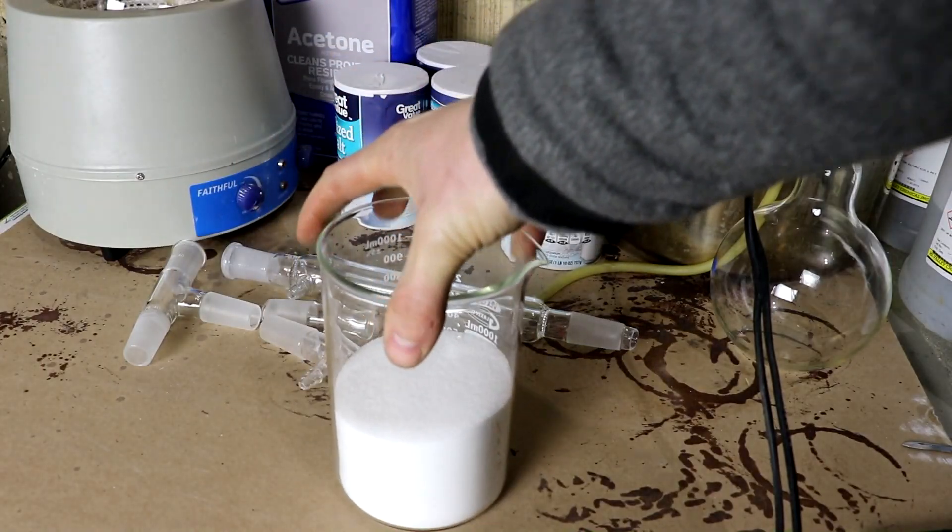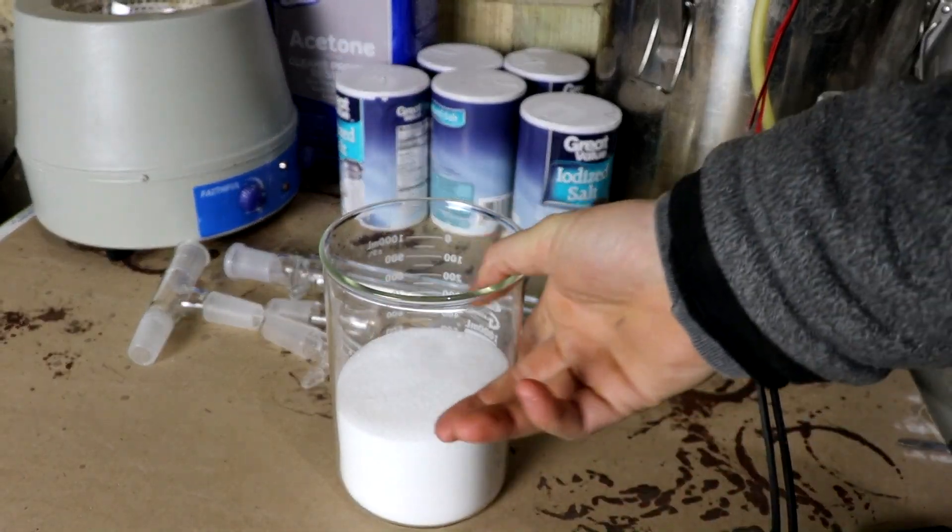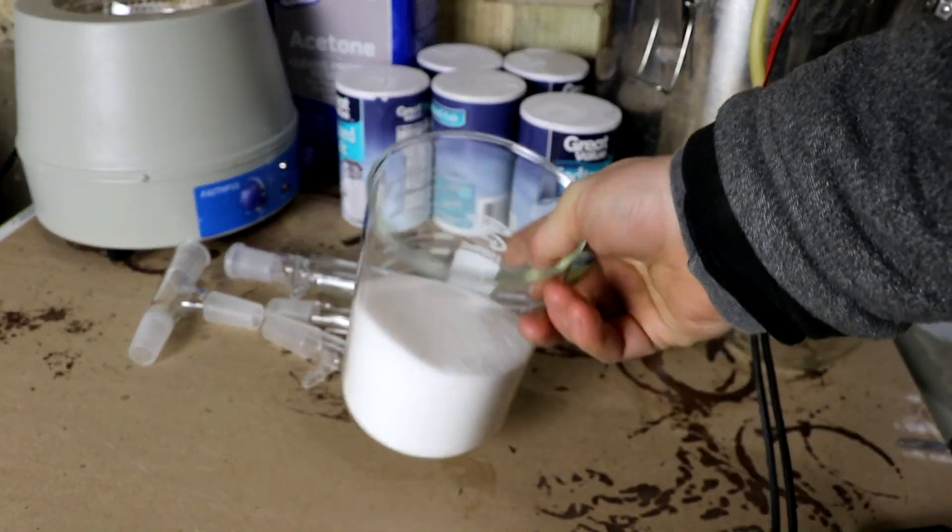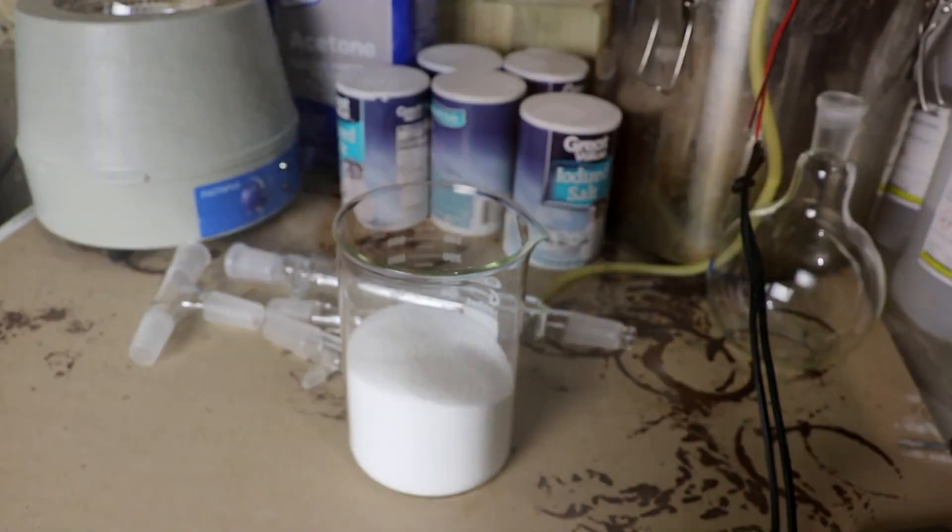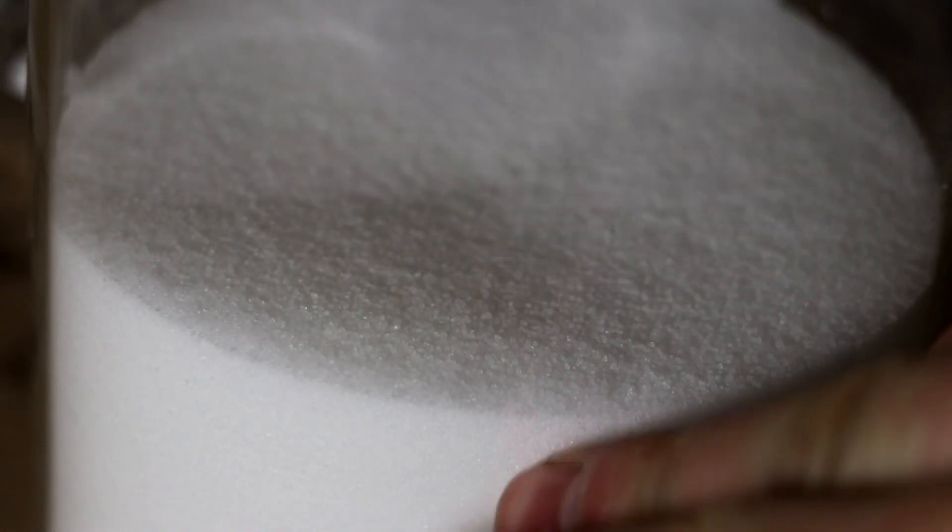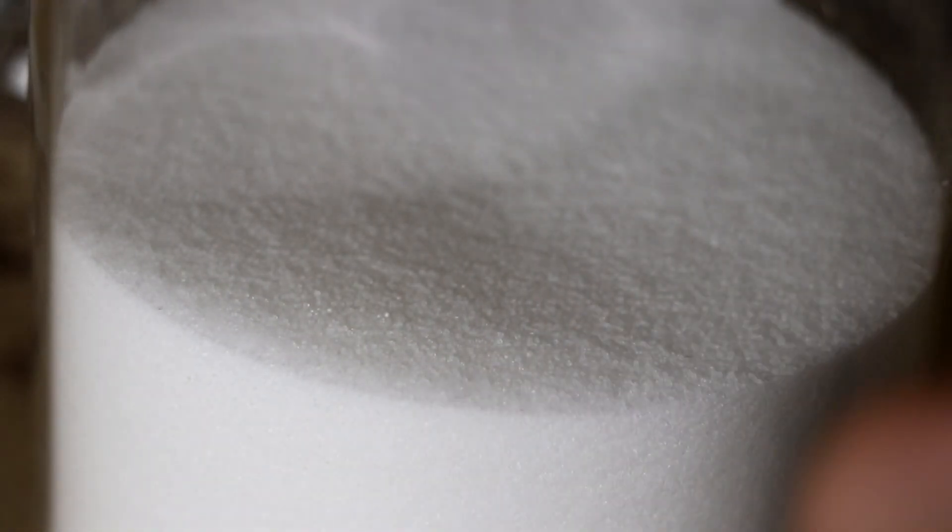I've got a bunch of sodium chloride crystals with a little bit of potassium iodide and some other stuff. I'm pretty sure that the potassium iodide is not locked inside of the salt crystals. I'm pretty sure they just add it to it after the fact. Which means, I don't have to dissolve the entire amount. I can just wash it off.